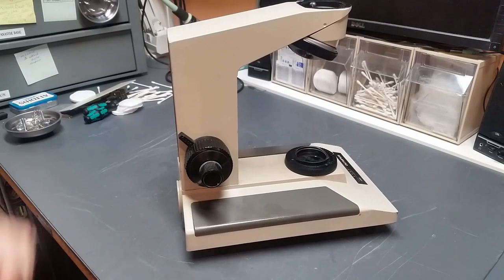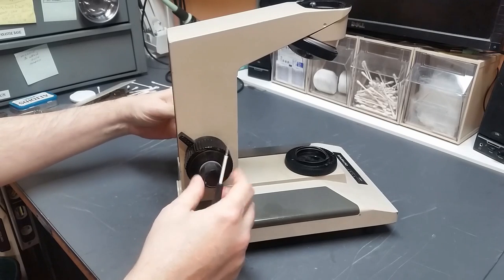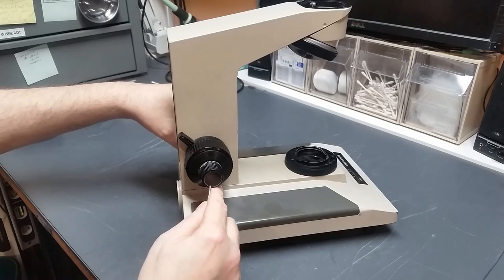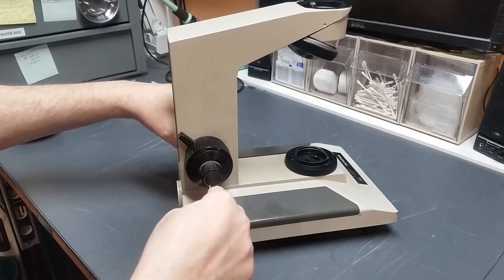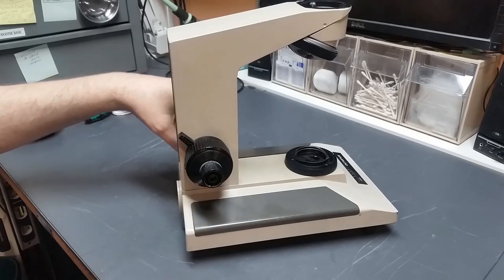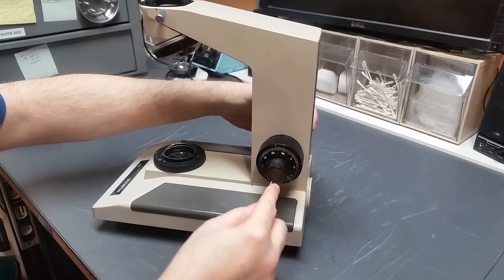Okay, the first step is to remove fine focus knobs. Got a little bit of wobble in the shaft there, so that shaft's a little bent. I'll see if I can address that. But in order to remove the knobs, the first thing you have to do is remove these disc caps from the ends of the knobs. There's a little notch right here. And if you insert a screwdriver of just the right size in there, you can pop the cap off, no problem. You can spin it around and do the same thing to the other side.